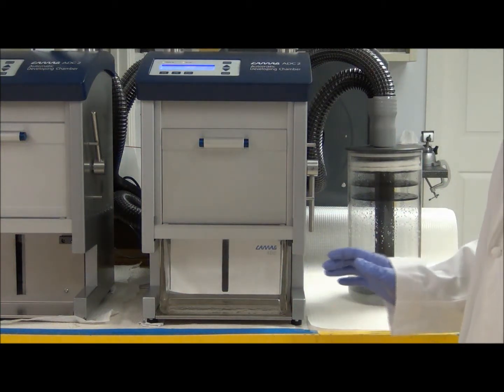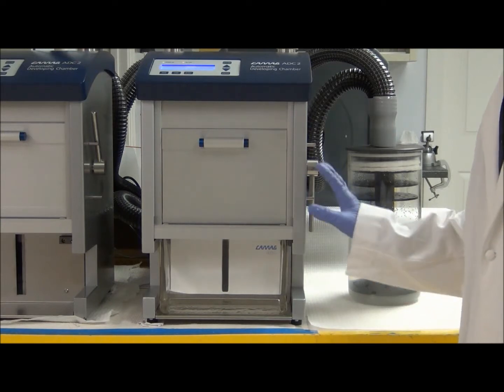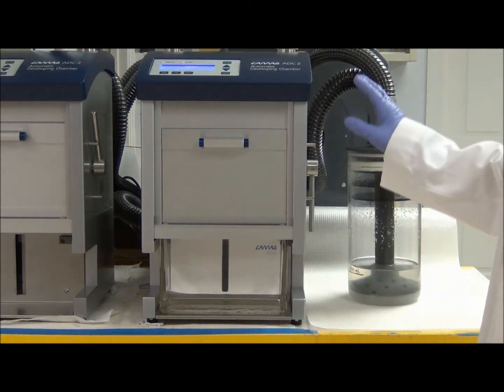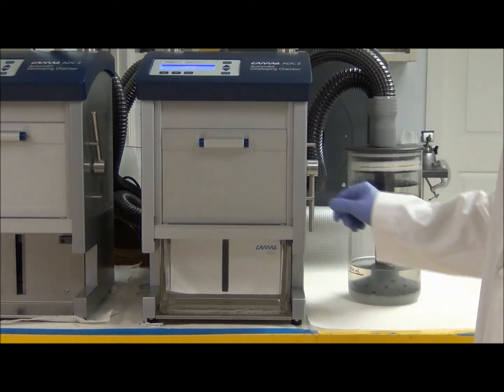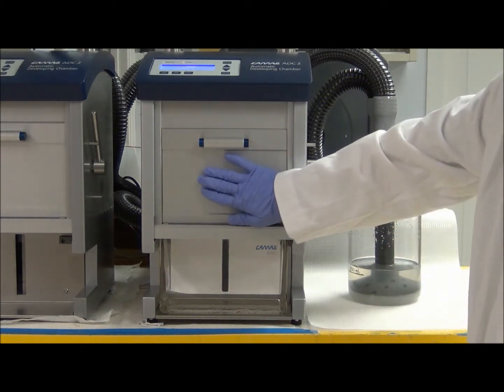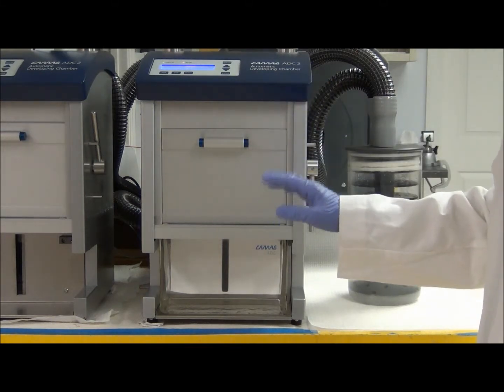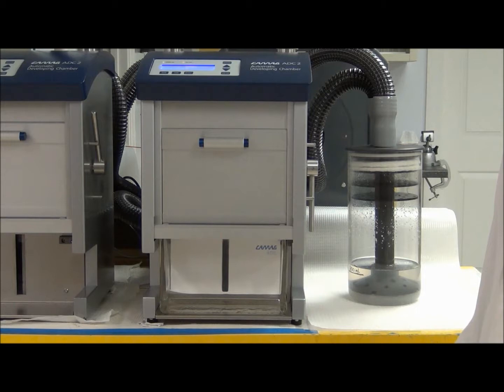The developing process is now starting. I've zoomed in a little bit so you can see the instrument more clearly. Right now the instrument is doing a pre-dry, so basically the plate is in here and ambient air is being blown over the plate to dry the samples just in case they weren't completely dry.